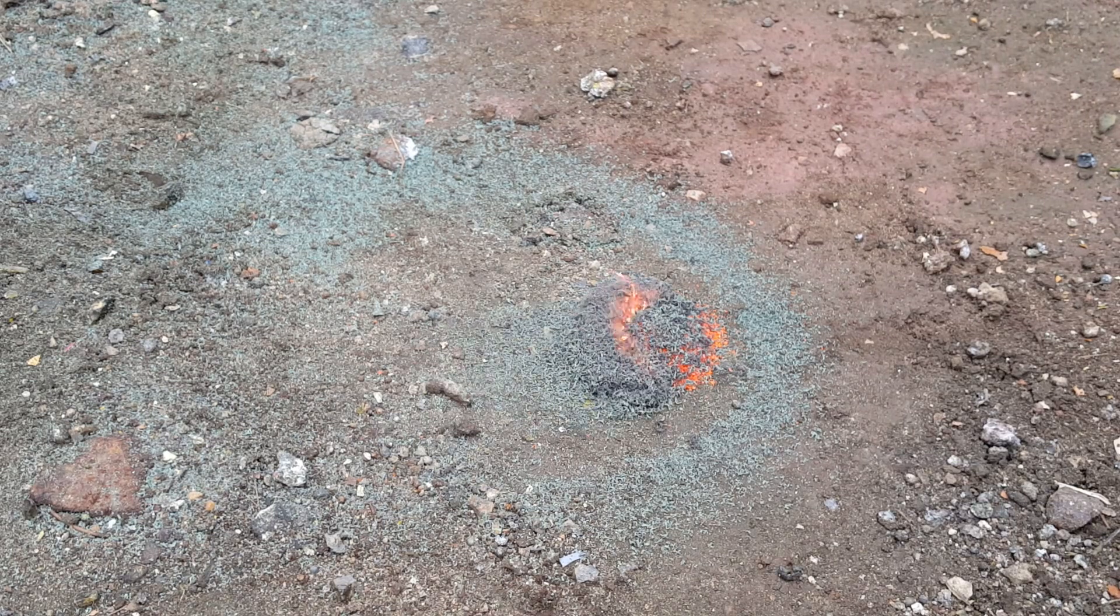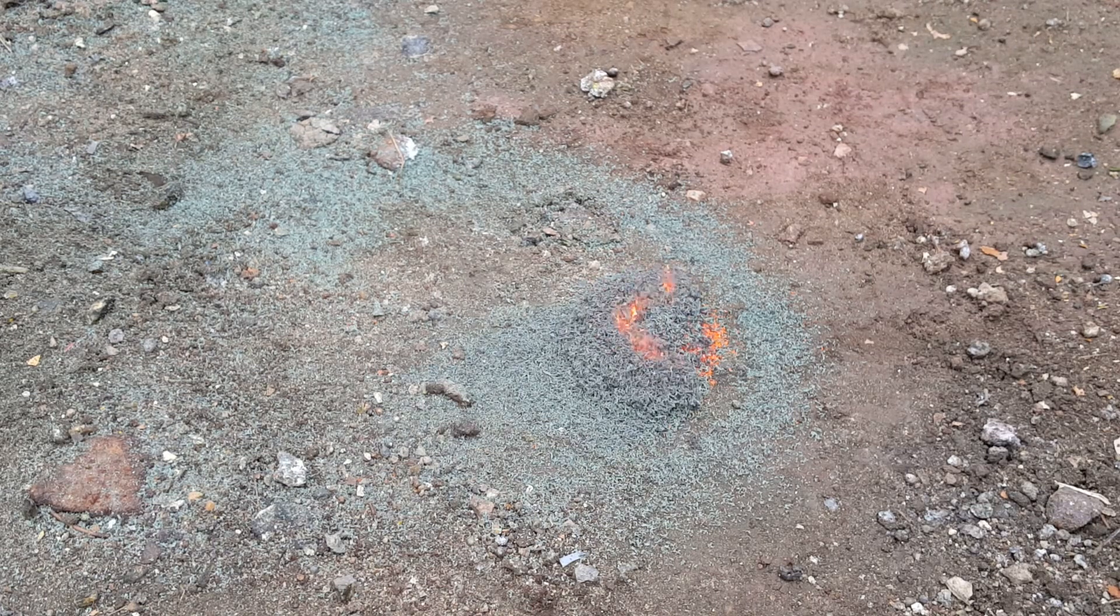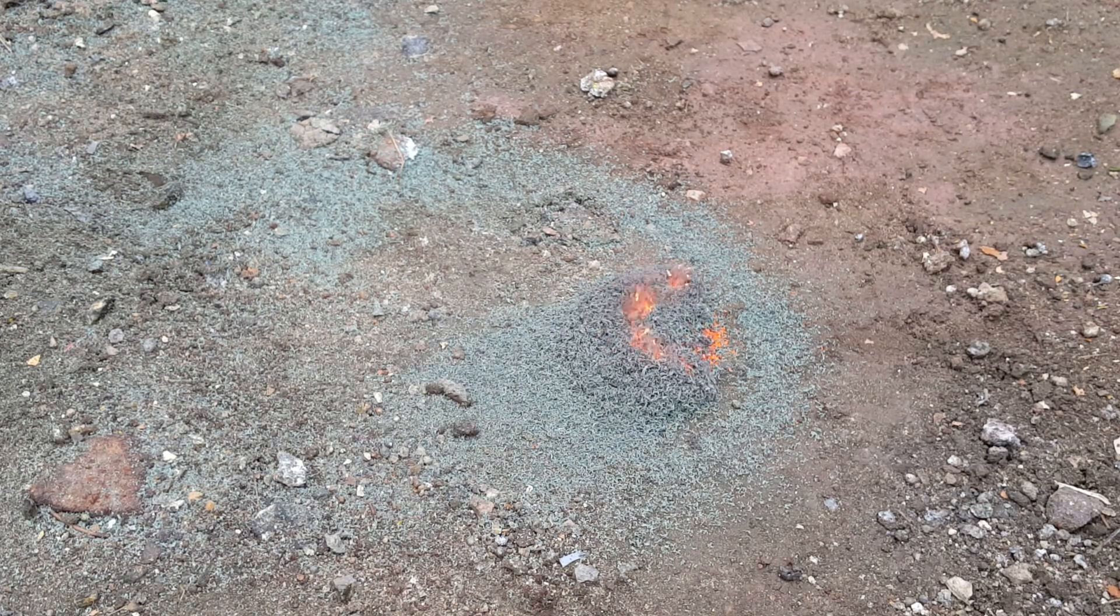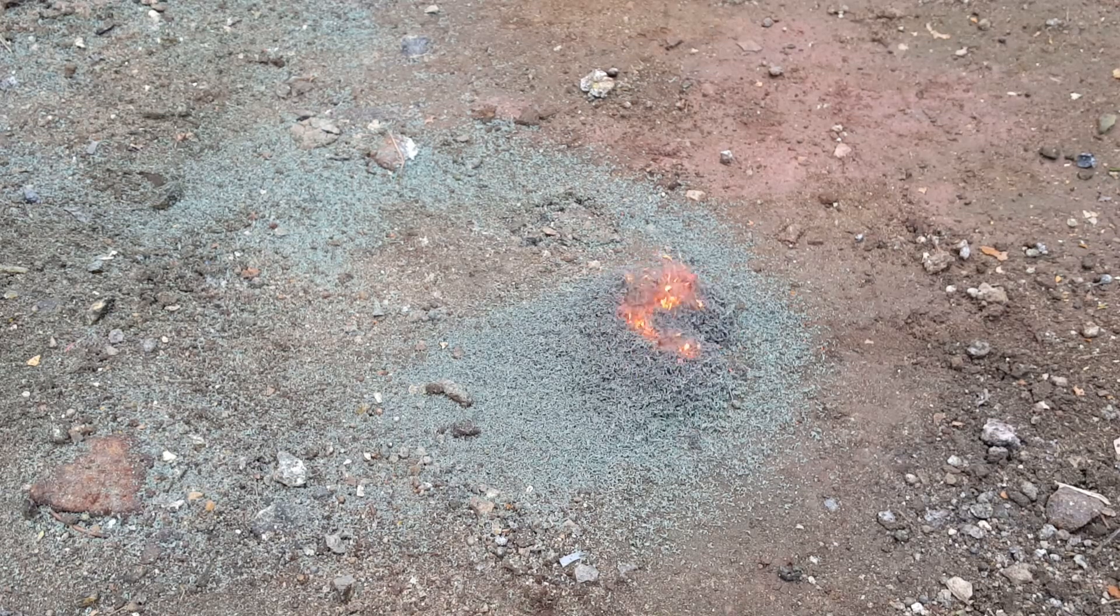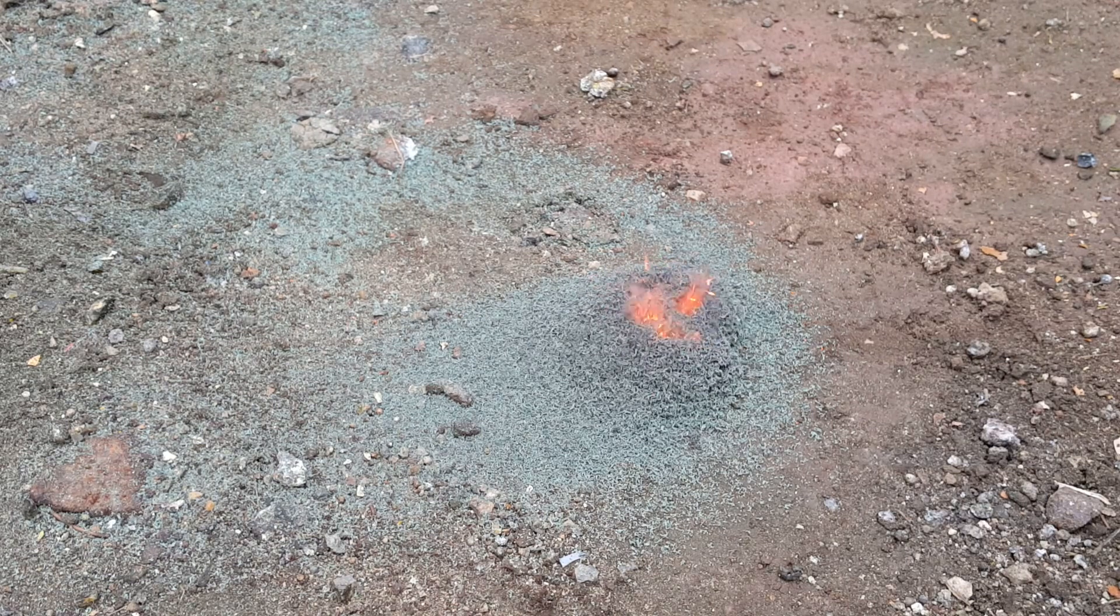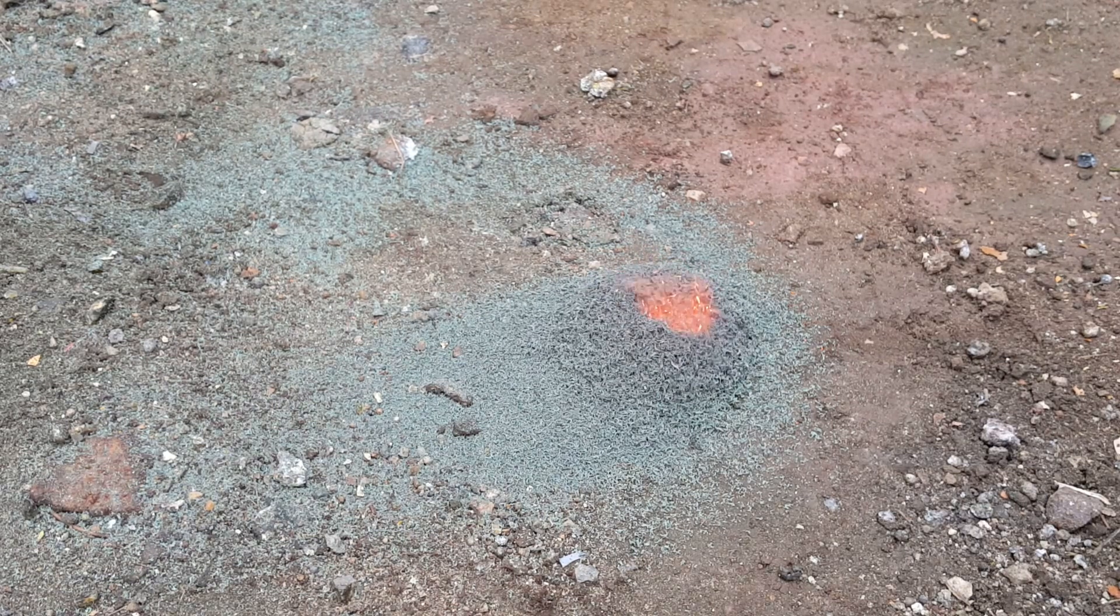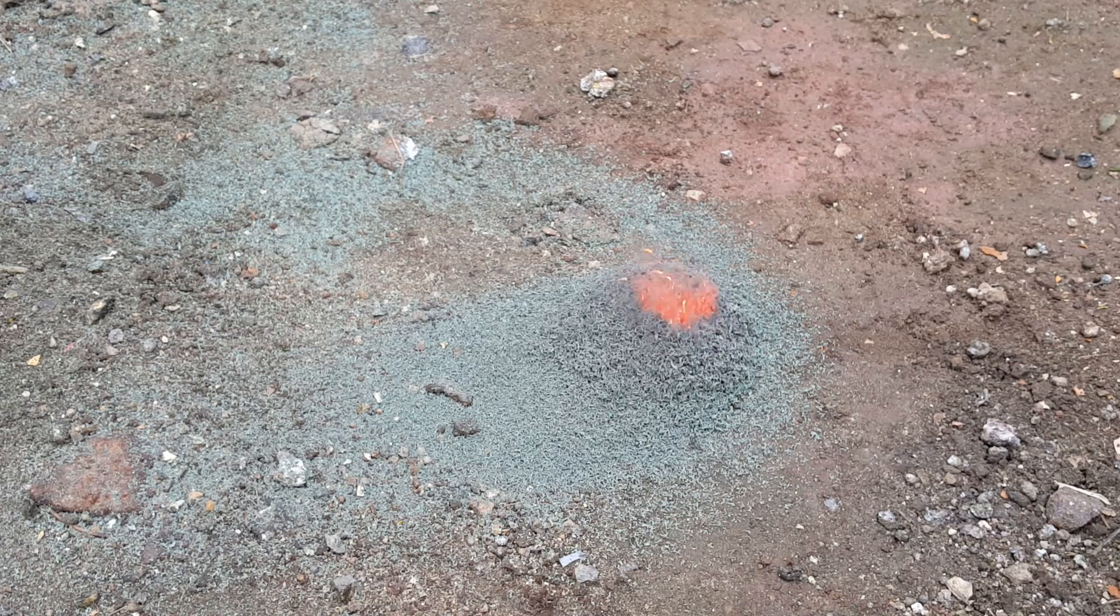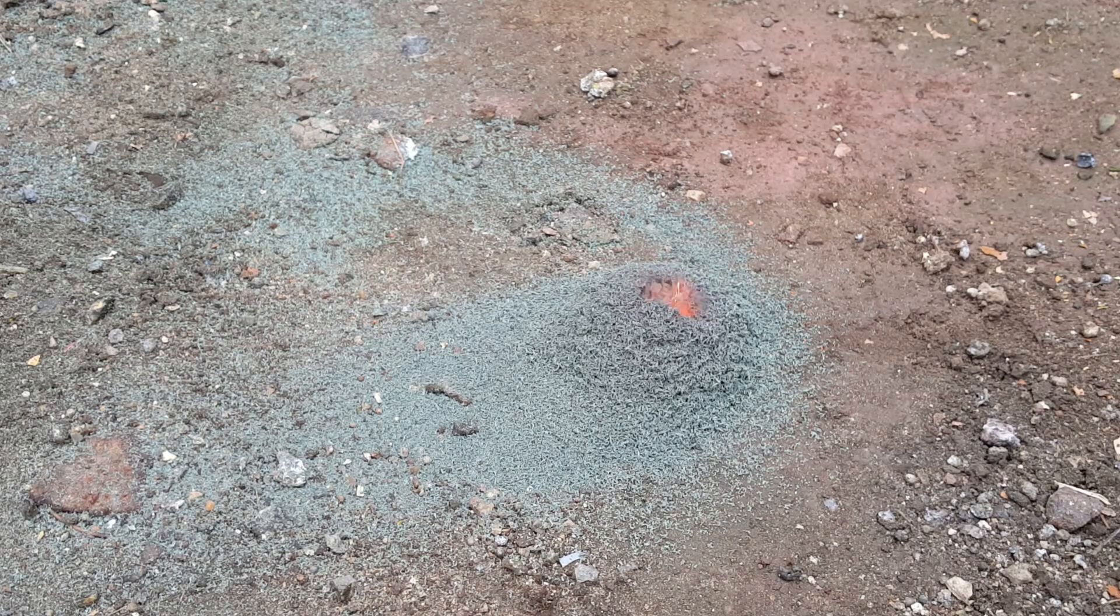The green substance you see is our chromium oxide, and our water vapor and nitrogen is throwing those red hot pieces of chromium oxide off the top and building the cone you see here.